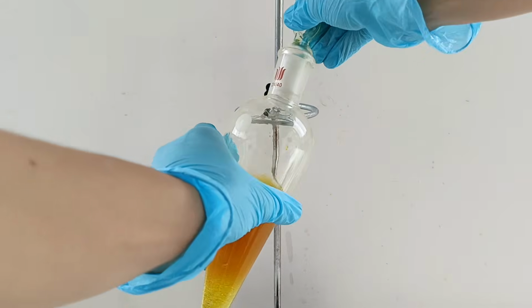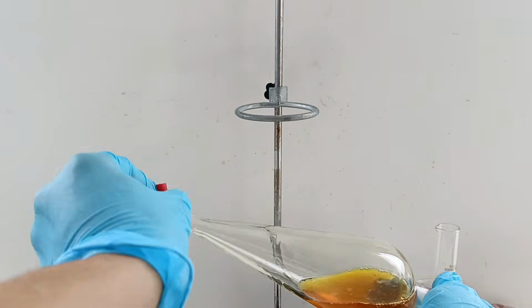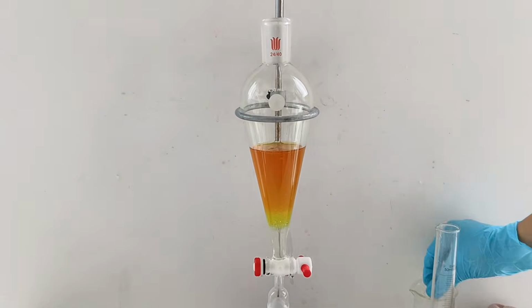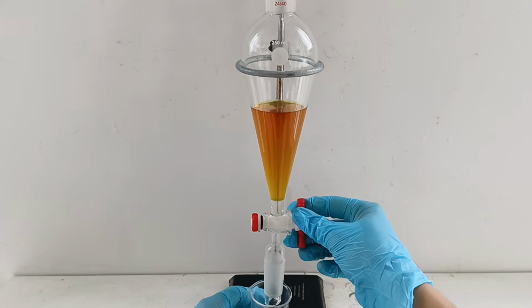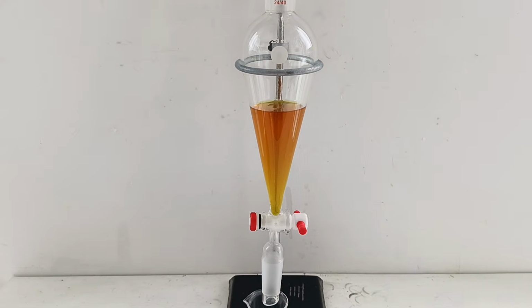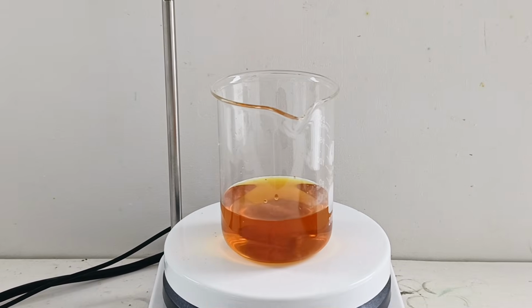Even though resorcinol is an organic compound, it is extremely soluble in water due to its multiple hydroxyl groups, which form strong hydrogen bonds with water, making it not very soluble in chlorinated solvents like DCM. This washing effectively removes any unreacted aminophenol, which does dissolve in the dichloromethane, while leaving the highly polar resorcinol in the water layer. The now cleaner aqueous layer is added to a beaker.